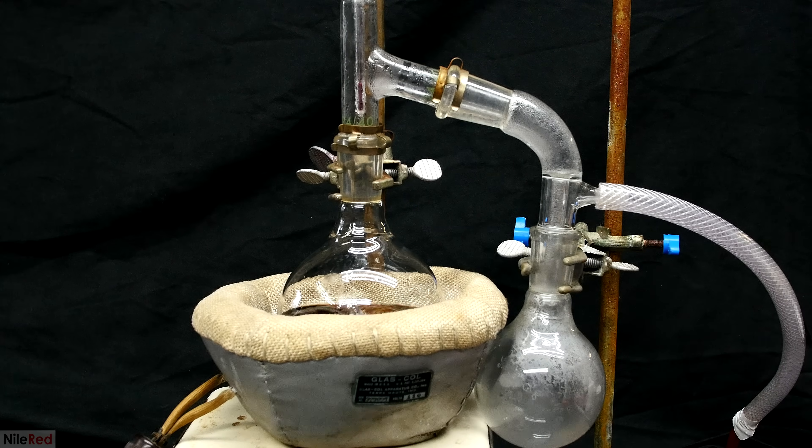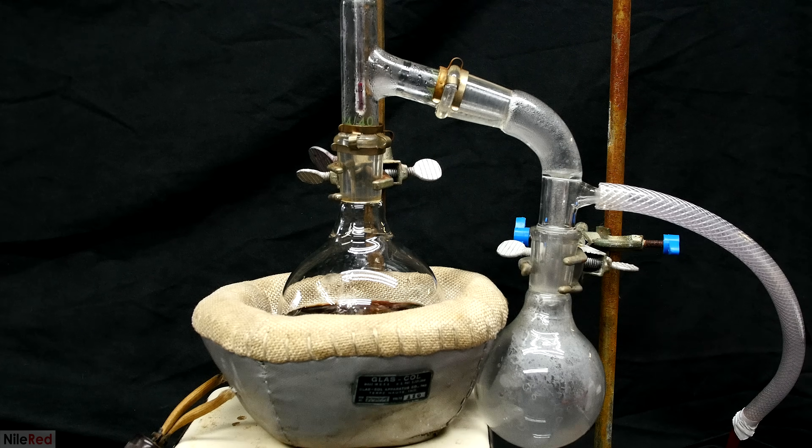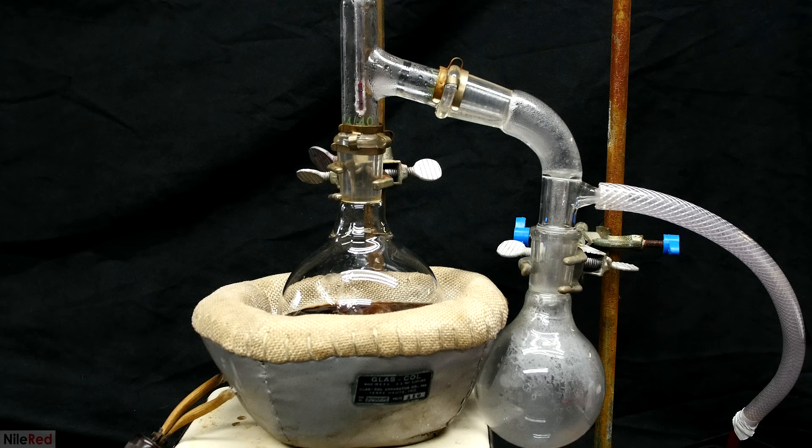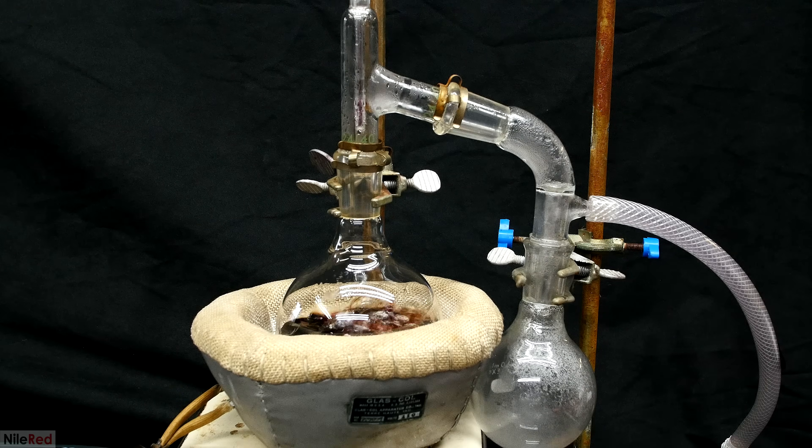It should be noted that water and phenol form an azeotrope, so any water that's present is going to co-distill with the phenol. For what I plan to use it for, I don't need anhydrous phenol, so this is okay.